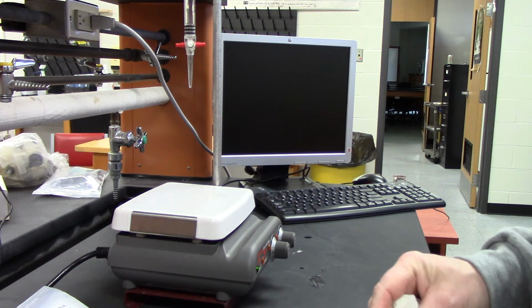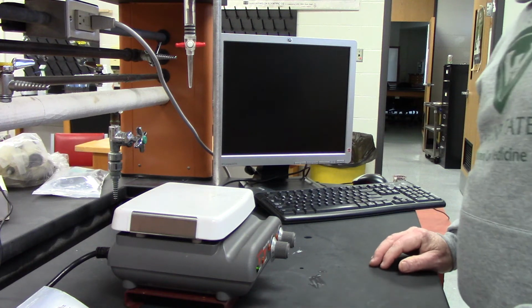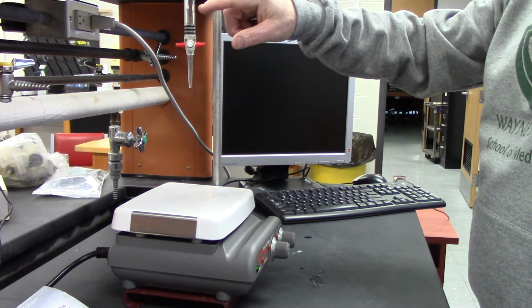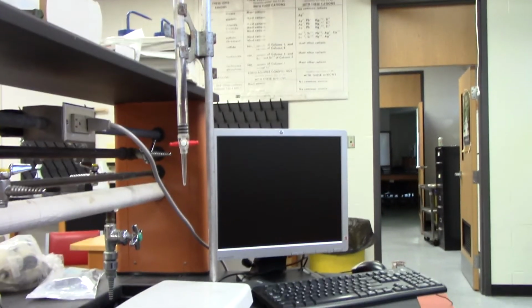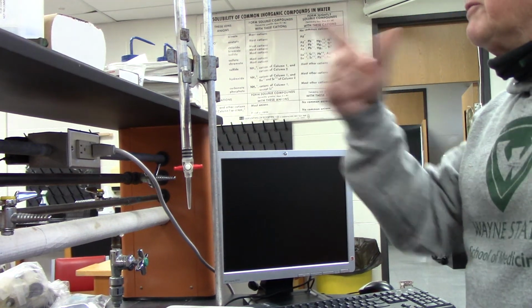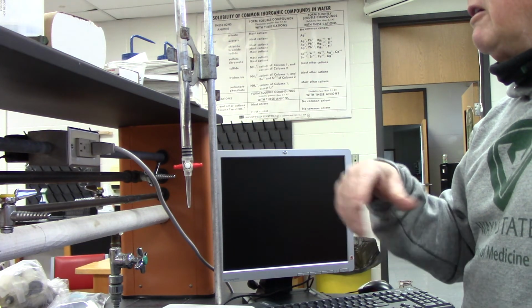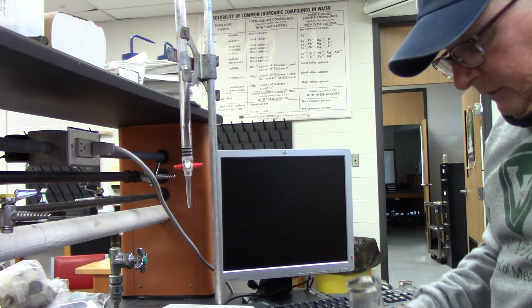All right, this one I'm going to take a chance a little bit, okay? So that one took 20 mils. And one was about 20 mils. So I have almost 30 mils in my burette here of my solution. So I'm not going to refill it. I'm just going to use what's in here. And I'll have final volume, initial volume, and I'll be able to figure out how much I added. So, skip that step.